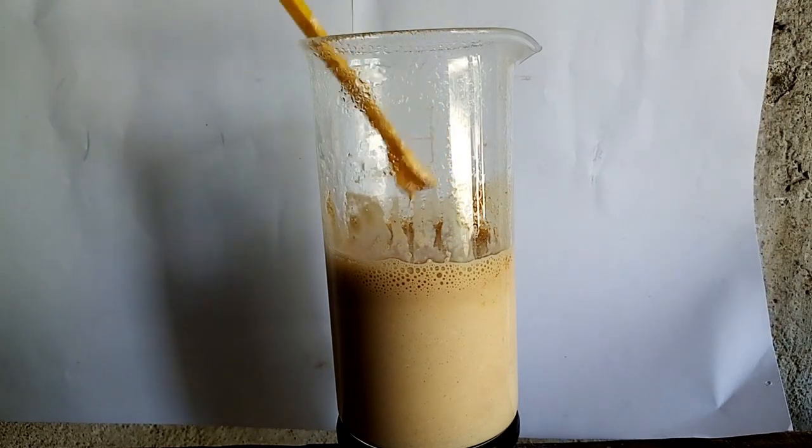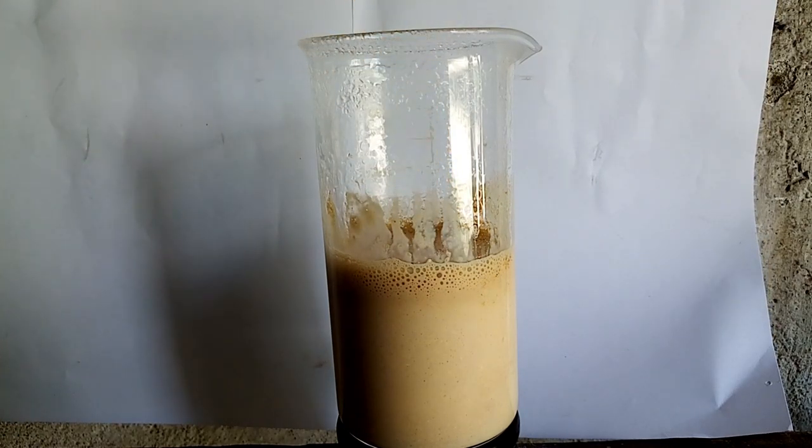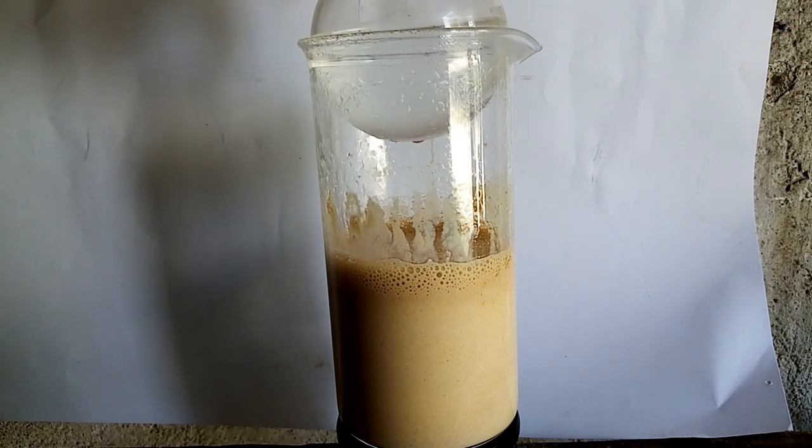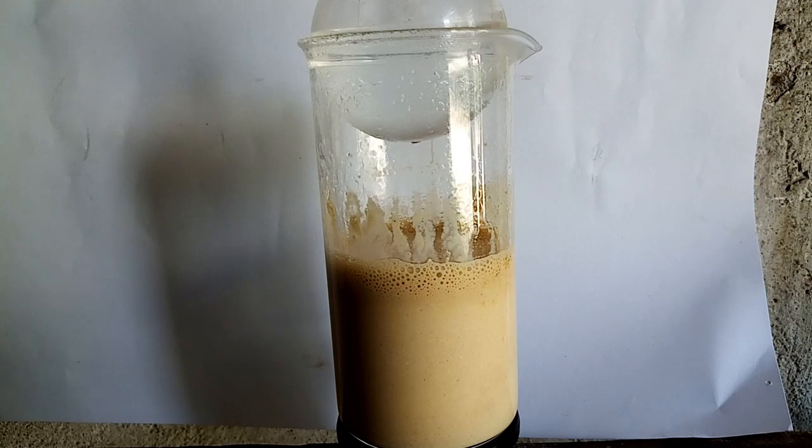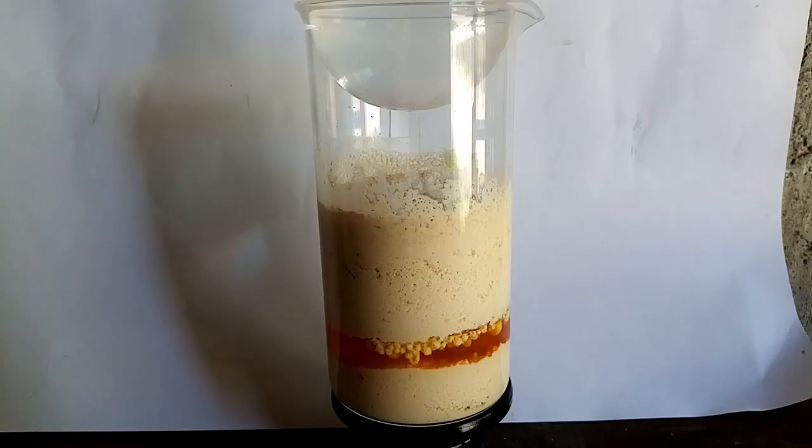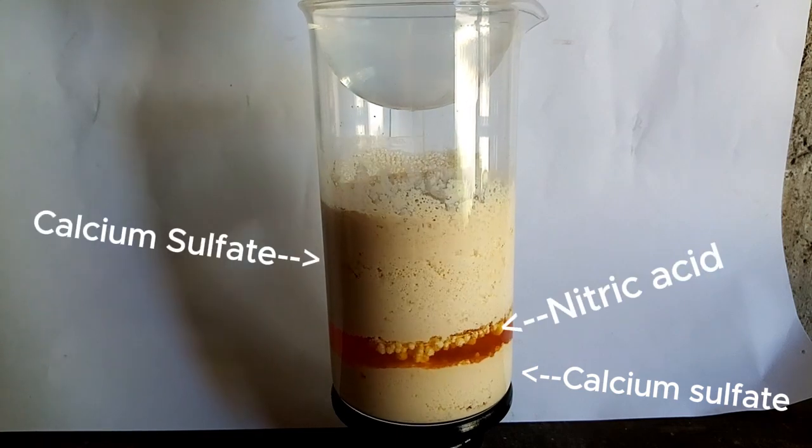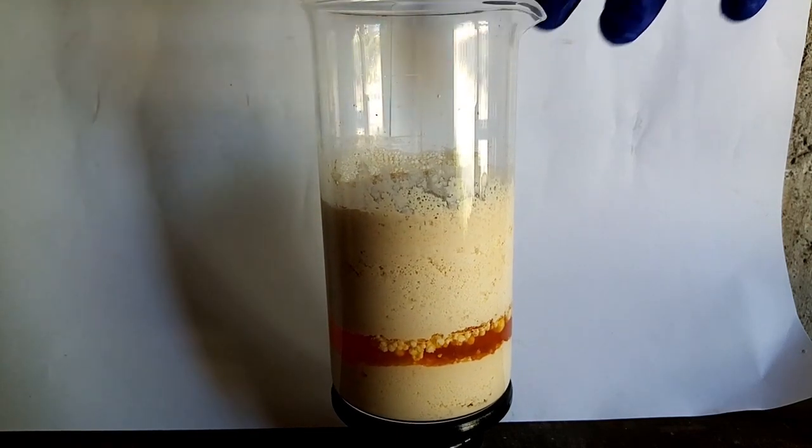After I make sure that most of the nitrogen dioxide is gone, I let it sit for a day to decant it off. The next day the mixture separated into 3 layers: one of calcium sulfate, another one with calcium sulfate and the nitric acid.